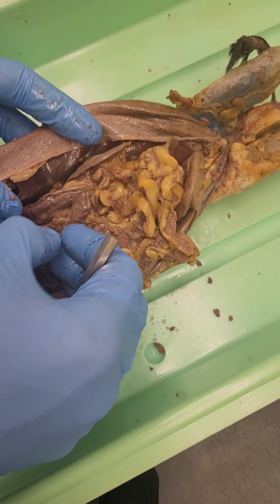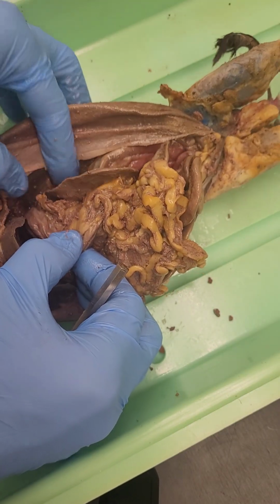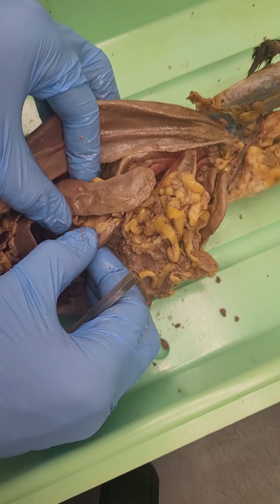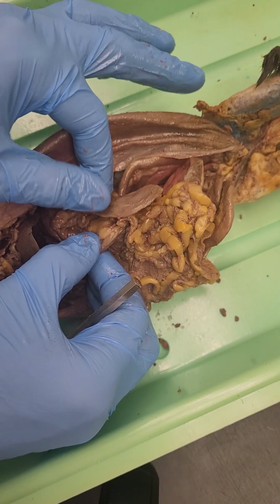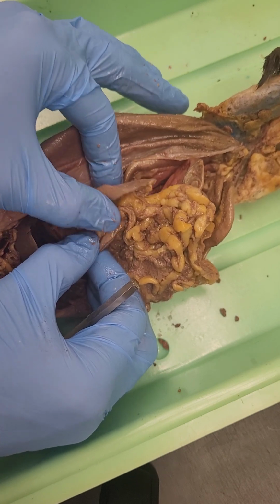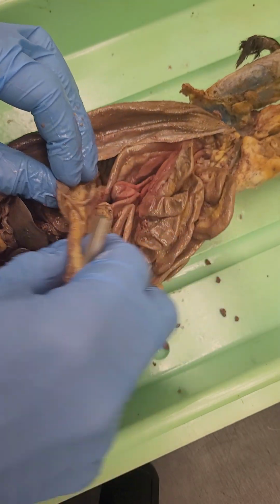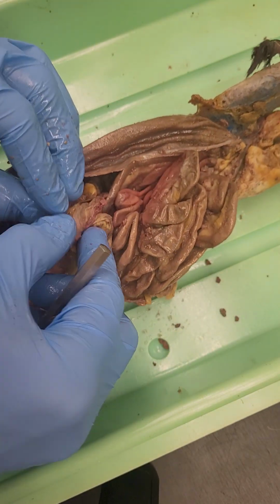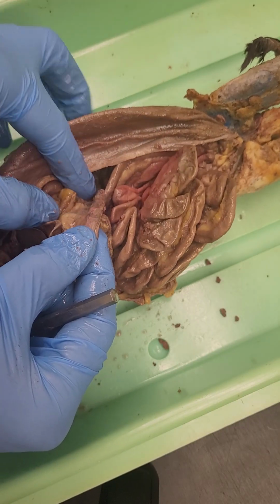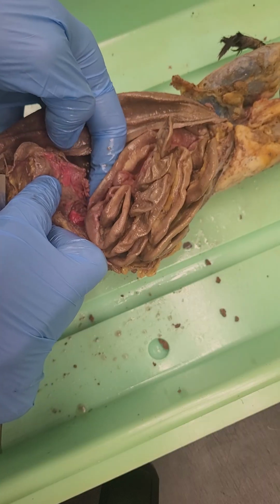If we look on this side of the stomach here, we look around, we find a spleen, which is responsible for blood filtration and removal of dead blood cells. But in mammals, it does not do red blood cell production. That instead is done in the bone marrow. So it's just a filtration and dead red blood cell removal. And underneath our omentum, we can see this structure here, which is the pancreas. There's that pancreas. That's going to be connecting over here to our duodenum.